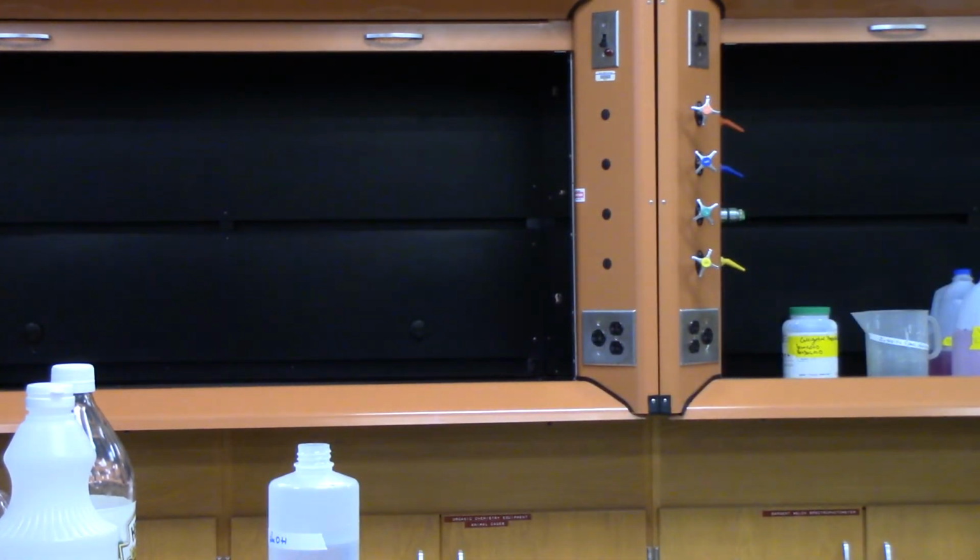Also, what I'm going to do is get the stir bar out. Okay, now I take number 2, and we're going to do the same thing.